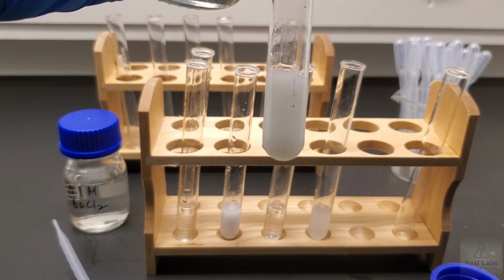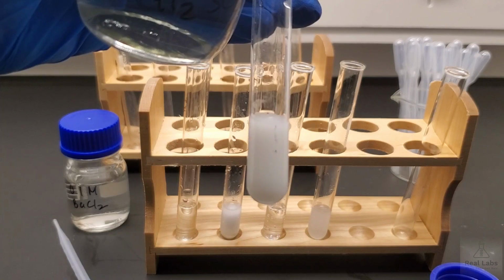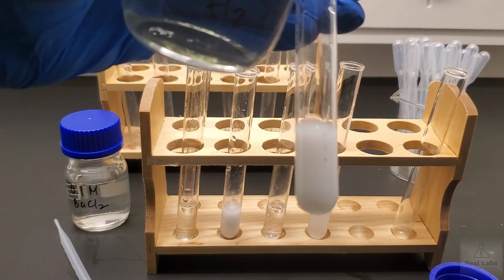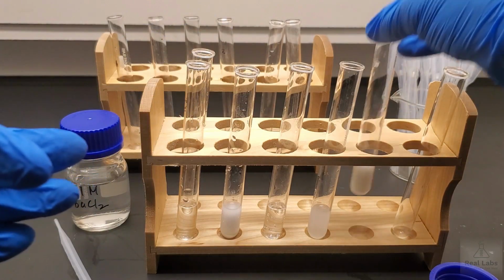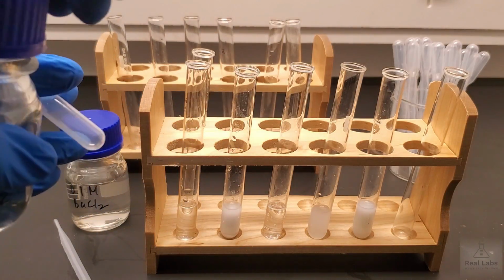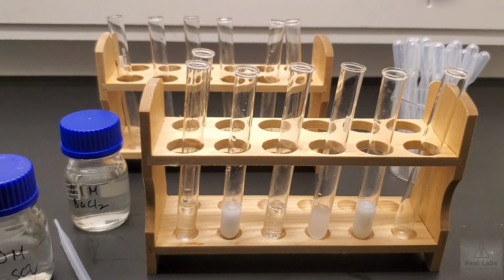And you can see as soon as we add that, there's clearly a reaction occurring. It's for you to determine what you thought you saw there. Most times when we see a milkiness like that, we're basically forming a solid inside of a liquid system. Kind of like milk is, right? Milk is basically milk fat suspended in this aqueous system. You're seeing the same kind of thing here.